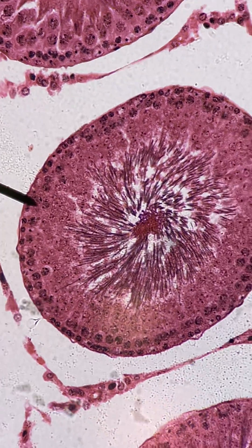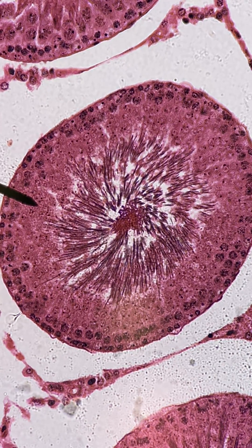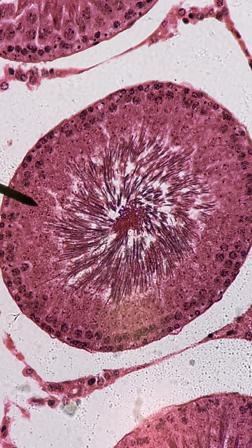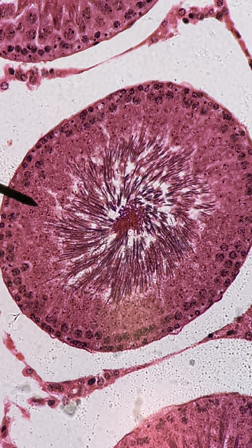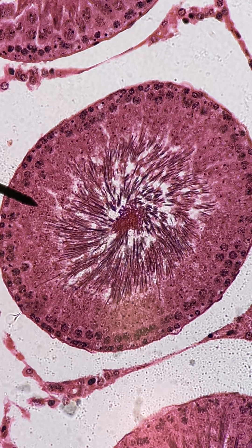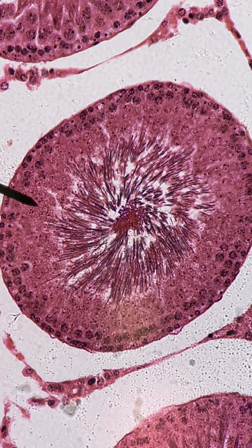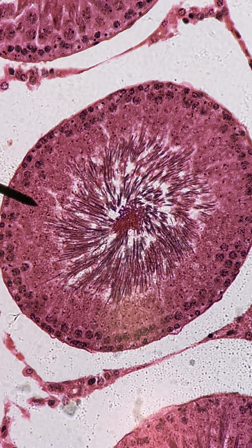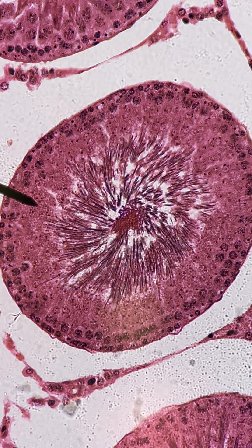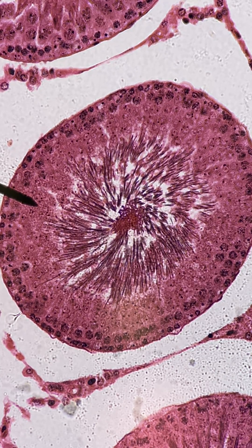If we look inside of one of the seminiferous tubules in the walls, inside of the tissue here, you'd find cells called sustenticular cells, or sustentacular cells — that's what it's listed as in your book. You don't have to identify them per se. Know that this is where they're found, and these cells produce, among other things, a hormone called inhibin, which is produced after maturity and helps the sperm cells mature.